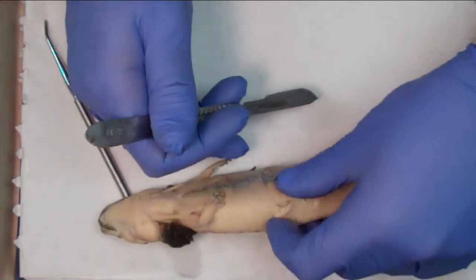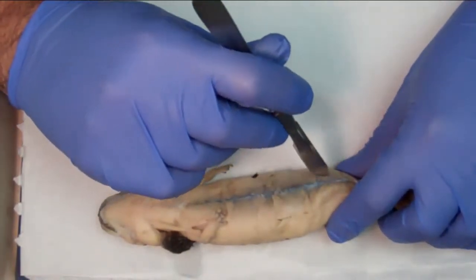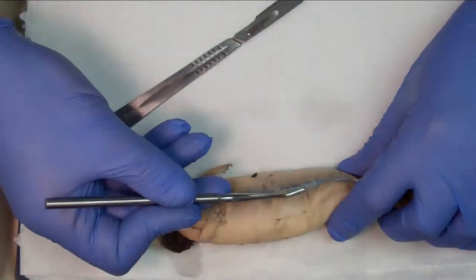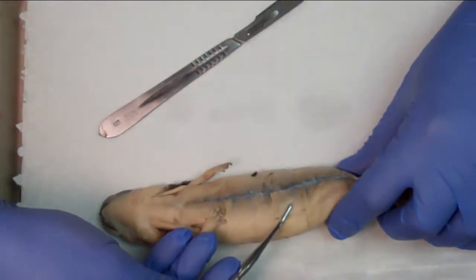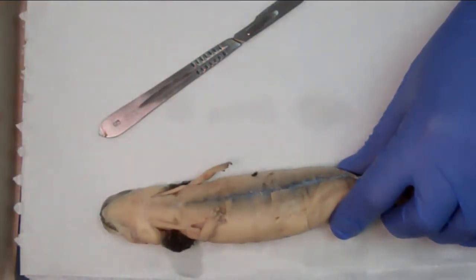At the core of it, the fibers here are going to be difficult to see in the video again, but they now run parallel to the midline of the body. And there's a gradual transition from the muscles running this way to the muscles running this way. These guys will be the external oblique, but at the very core is going to be the rectus abdominis. And those are all the trunk muscles we need to cover.